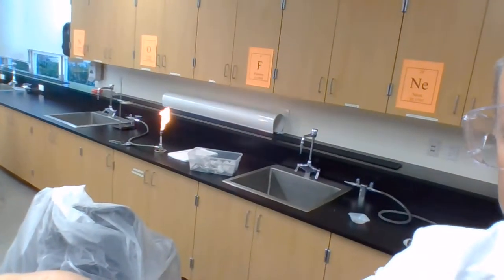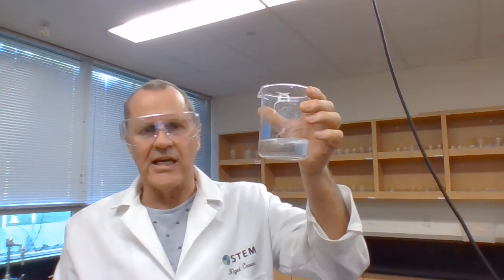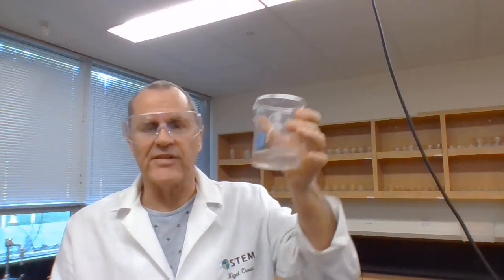It's on the safety flame at the moment. What I'm going to do is evaporate all of the water, and then I'll be able to find what's left. So what's in there is the product. Well, carbon dioxide is a product, but that's not in there. But sodium citrate, that's not a gas. That's an ionic compound. That's in here in aqueous form. And also in here in aqueous form is the reactant that's in excess.